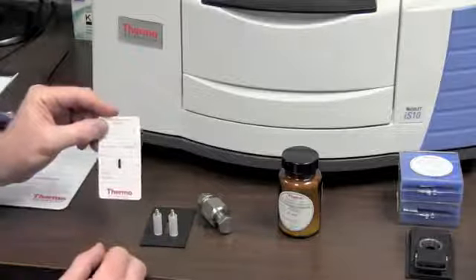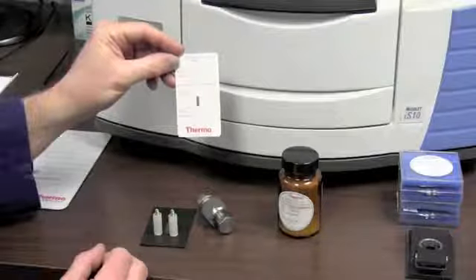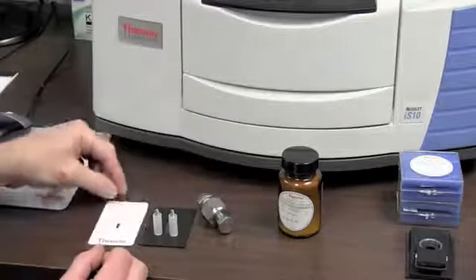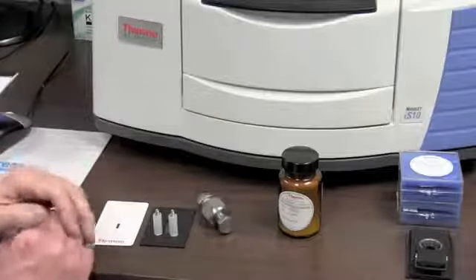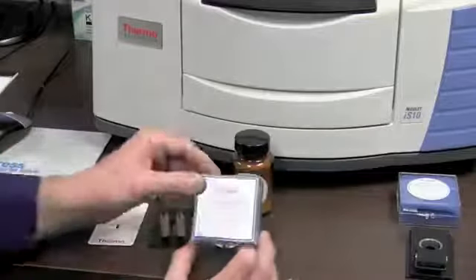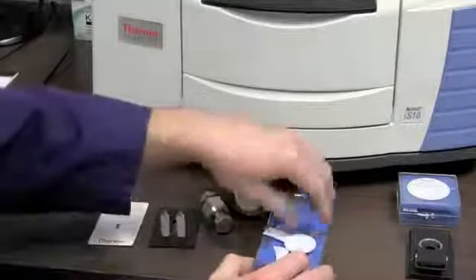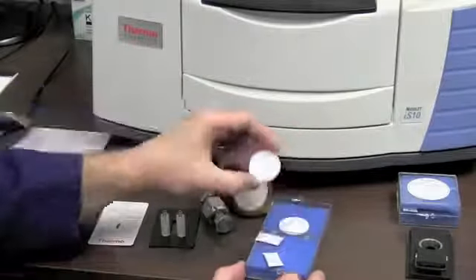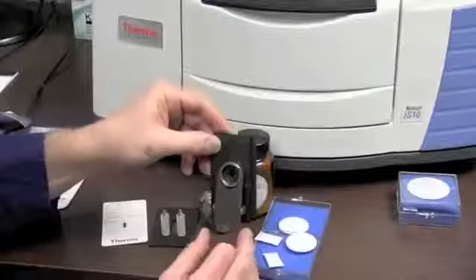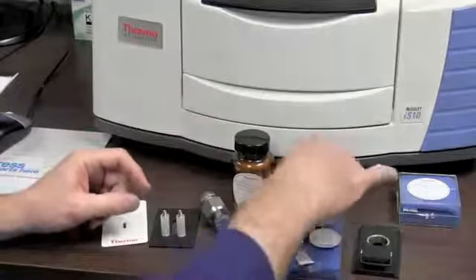Another way is with a thin film. If the sample is already thin, or it can be pressed into a thin film, we put it in this cassette, and then we put the cassette in the light path, and we read the analysis from that. We can also do Nujol, which is liquids. They're placed on sodium chloride plates. Put two of them together with the liquid between it and shine the light path through there, put it in that holder, and we can measure that material in liquid form through the glass plates.